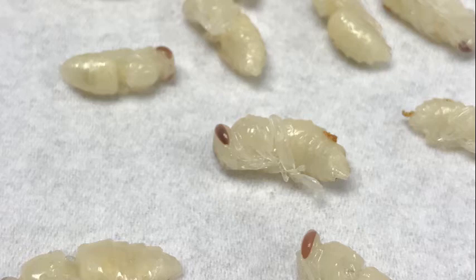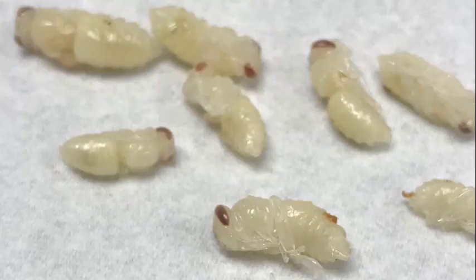Related to this larval rearing protocol, we use another method that we developed that also involves rearing brood totally in the laboratory. But this one is done a little differently and with some other purpose. A lot of those experiments I talked about earlier, where we use virus infections, for those we have to produce the virus particles, the viruses themselves that we use to infect the bees.